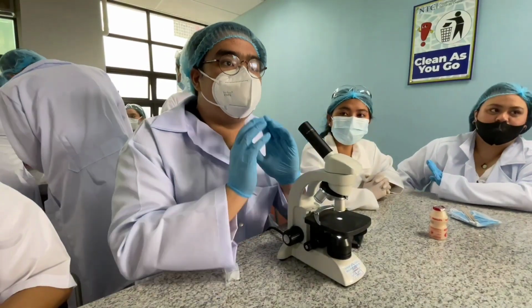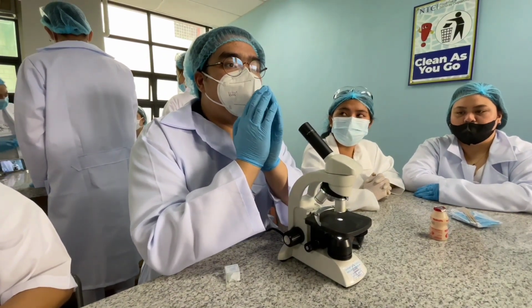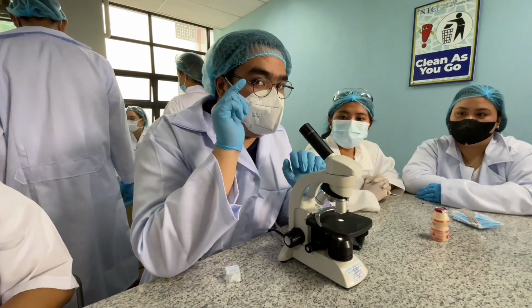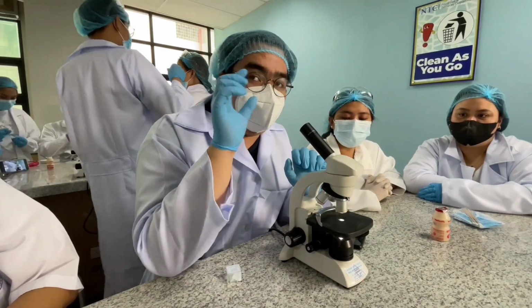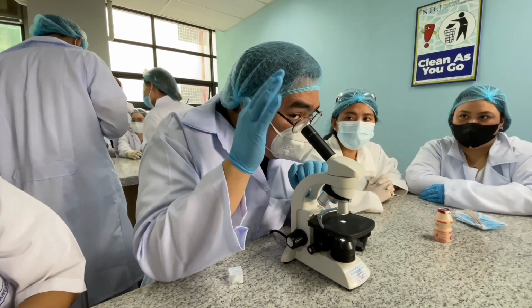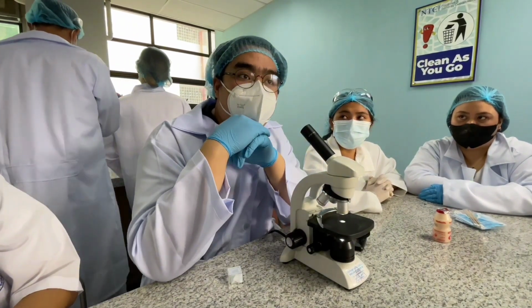And how do you use the eyepiece? Can you care to demonstrate? Now, whenever you use the eyepiece, never actually touch it like how you use a telescope or binoculars. Always keep a safe distance, like this. Never touch it. All right. Now that's how you use an eyepiece.